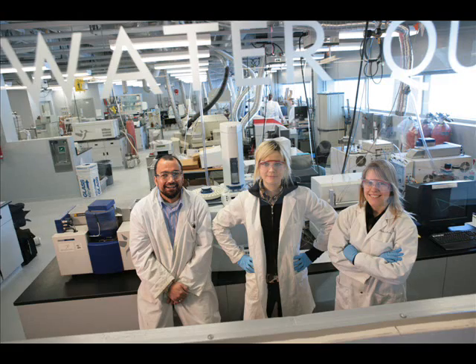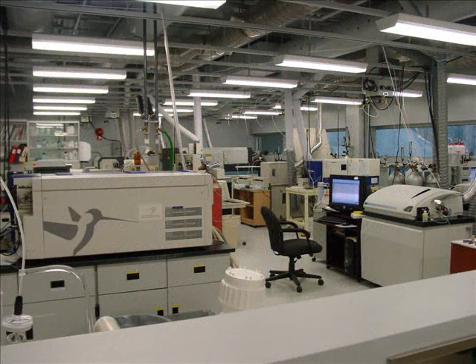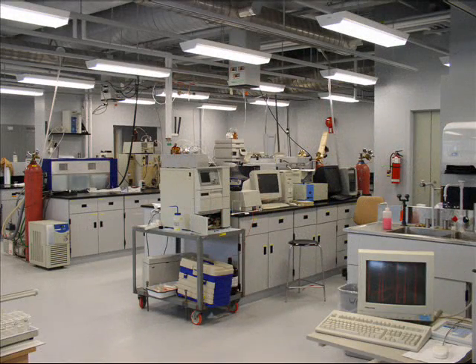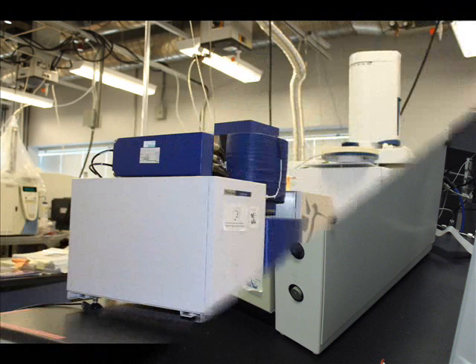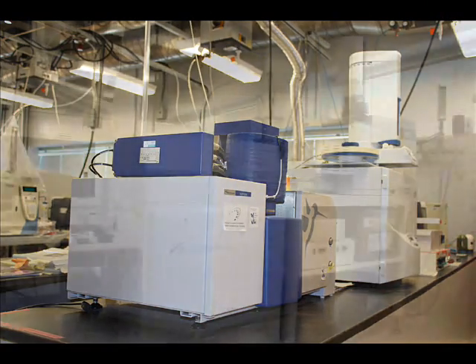The Water Quality Center at Trent University is a state-of-the-art mass spectrometry lab dedicated to research method development and the analysis of very low levels of inorganic and organic contaminants in the environment. We have two continuous flow isotope ratio mass specs. One is dedicated to carbon-nitrogen isotope ratio analysis, and the other one is dedicated to delta O18 and deuterium analysis.